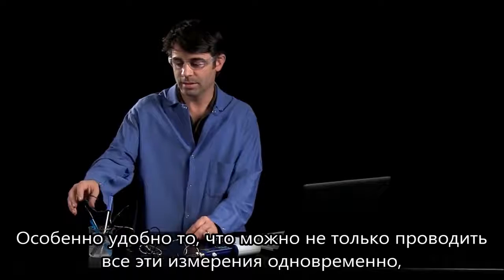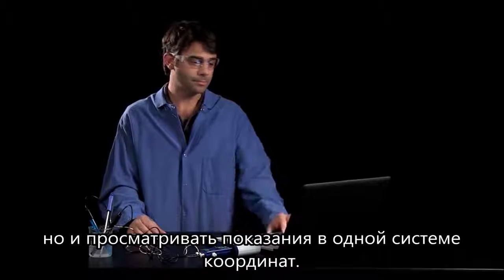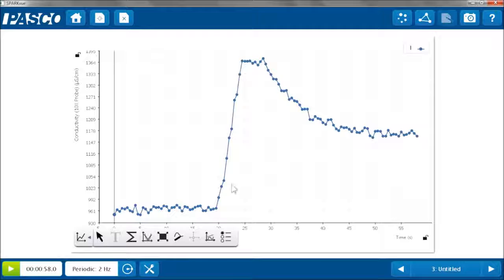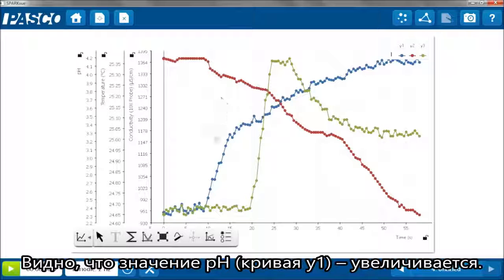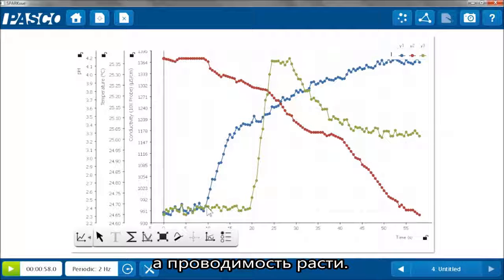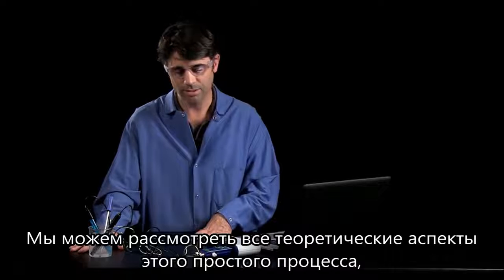The really nice part about this is, since I was making those measurements simultaneously, I can view all of them on one graph. And I can make connections between what was happening in each of those properties. So we'll look at our next page, and we'll auto-scale it. Now we can see my pH, which was my Y1, was increasing. At the same time, my temperature started dropping. It's my Y2. And the conductivity started to increase. So we can tie in all those concepts with a very simple process.